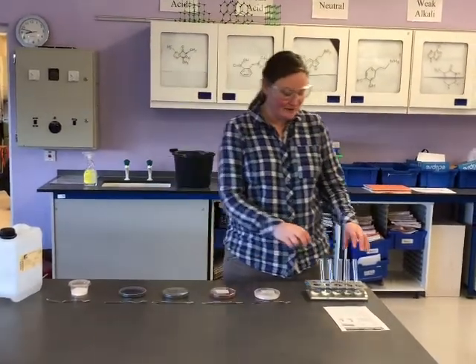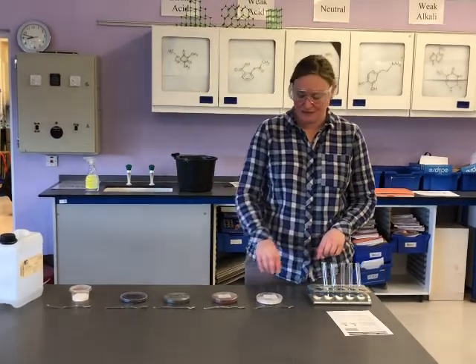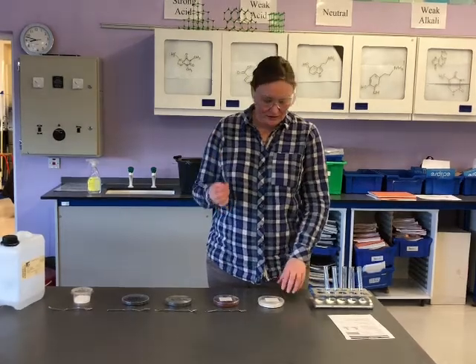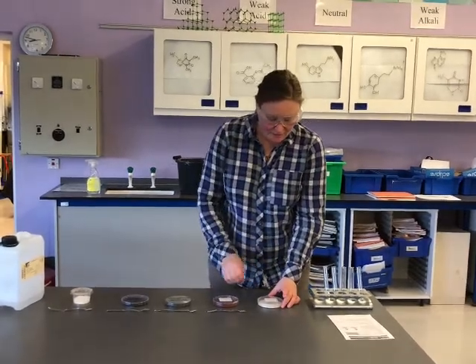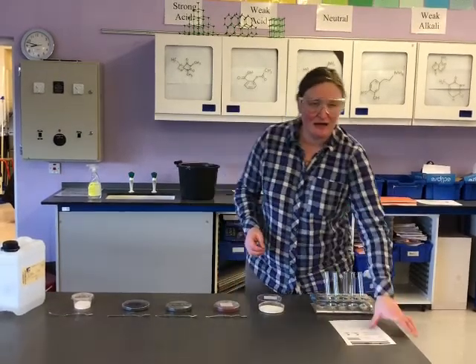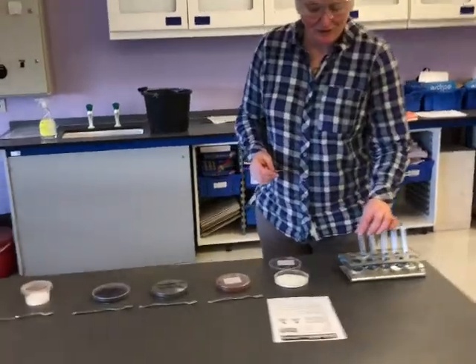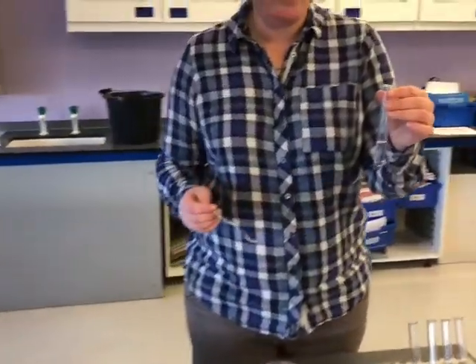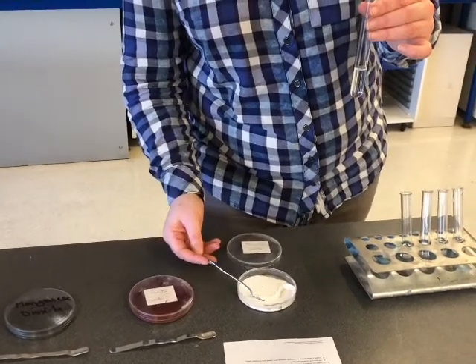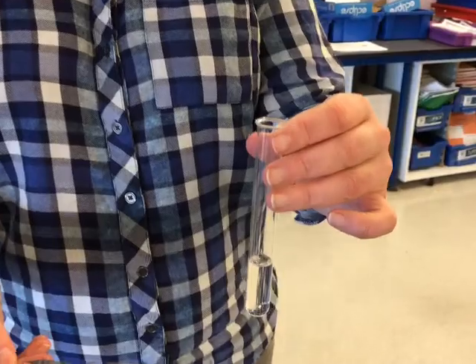Okay, welcome back. I've now set up my 5 test tubes full of 5 centimetre cubed of hydrogen peroxide. I'm going to take my first catalyst and use 1 spatula. The first particular catalyst that we're going to use is aluminium oxide. So I'm going to ask my lovely camera person to come a little bit closer and we want to see what's happening when we add aluminium oxide to our hydrogen peroxide. Okay, can we see that okay?